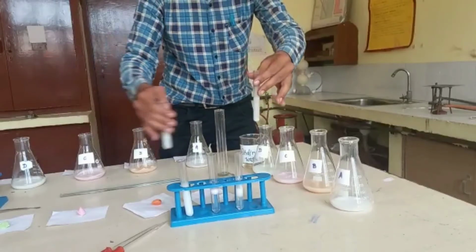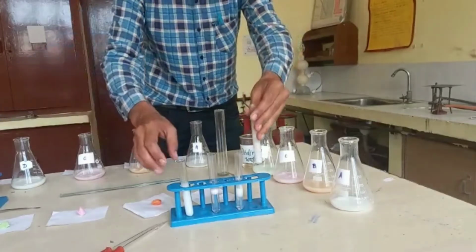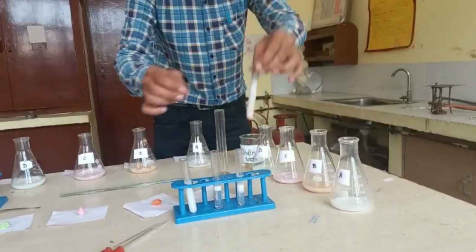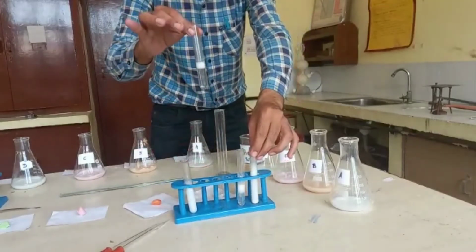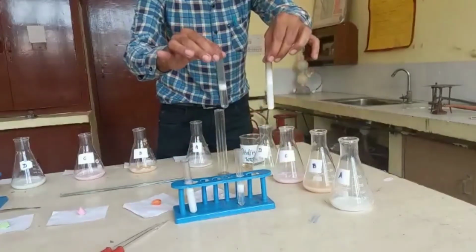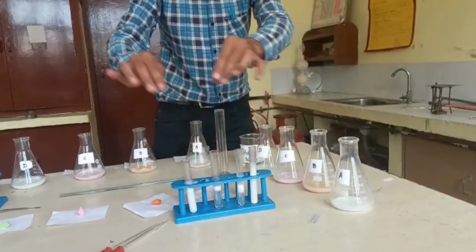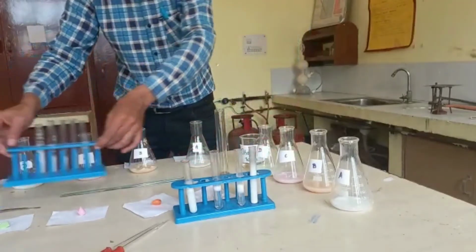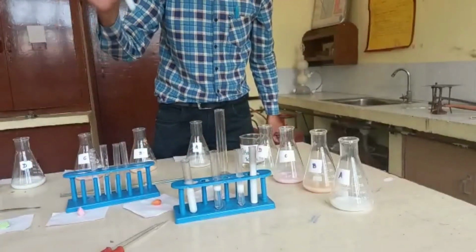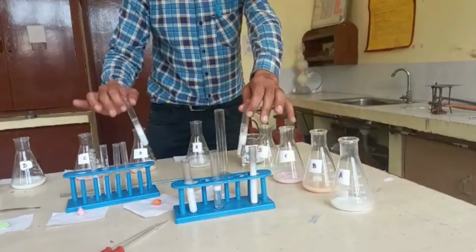And if I compare the foaming capacity of these different soap samples, I observe that sample A has maximum foaming capacity while sample C has minimum foaming capacity, which is clearly observed from these 2 test tubes. And secondly, I am repeating that more foam formation of these soaps takes place in distilled water as compared to ordinary water.